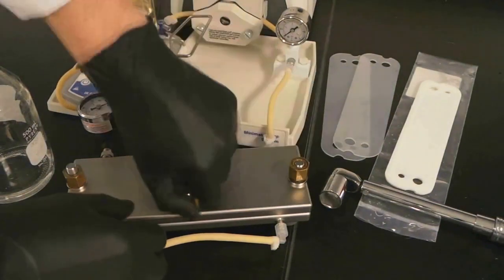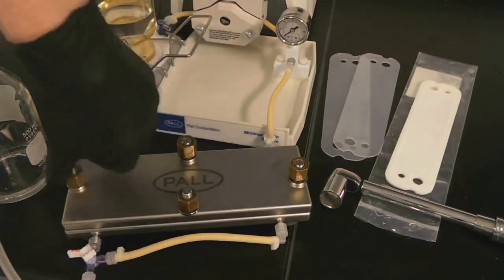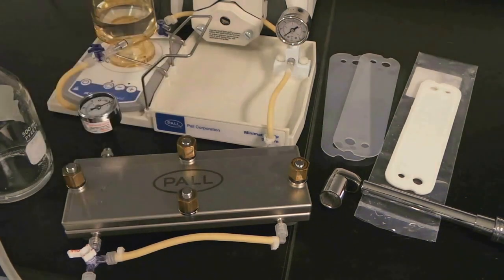To install a cartridge into the LV CentralMate, start by removing all the screws and washers, then remove the top of the holder.